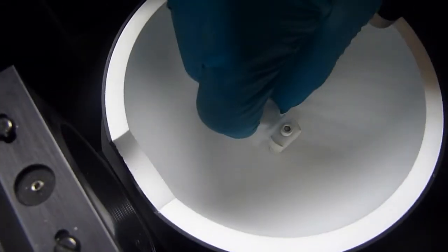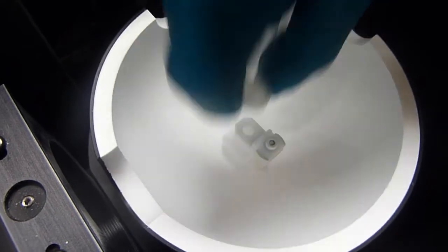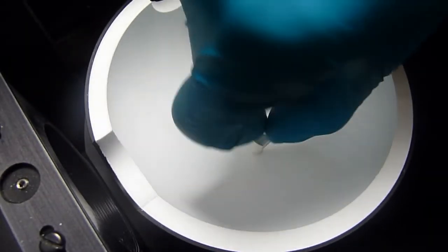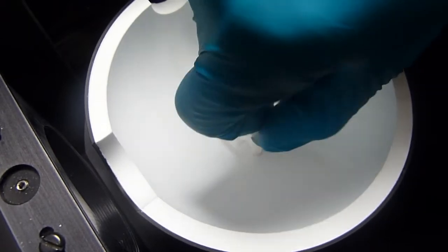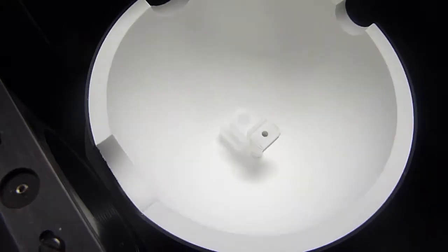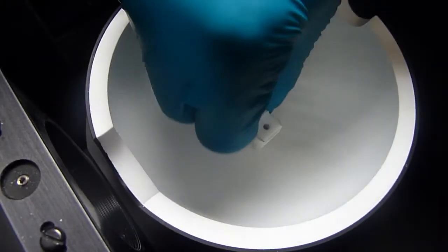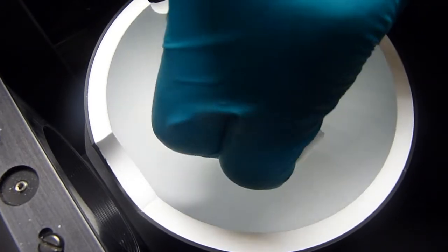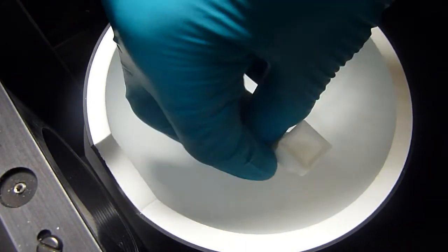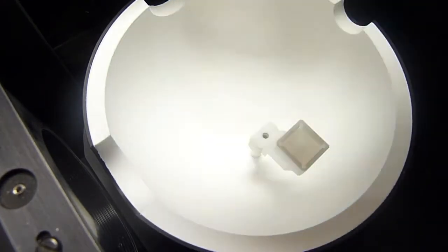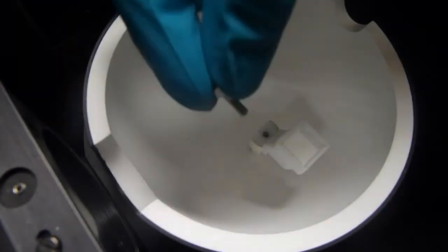If I wanted to use a liquid sample that's fine as well. I would just unscrew this screw here, take this out and place this on here, and then put my screw back in.